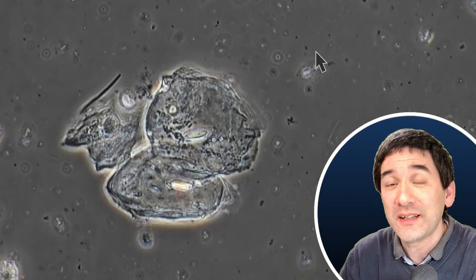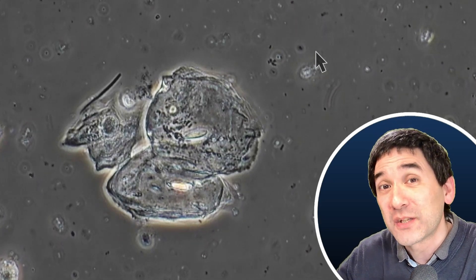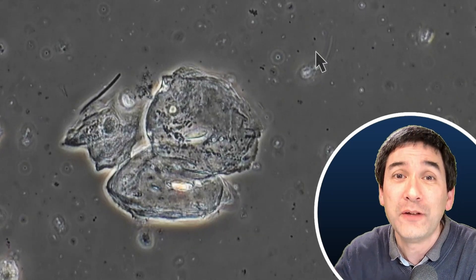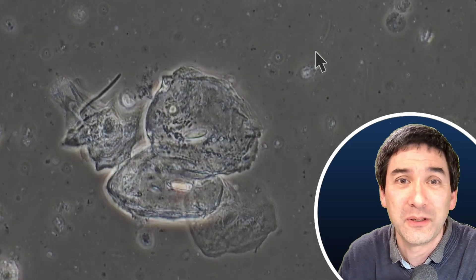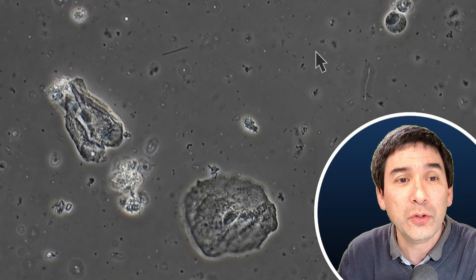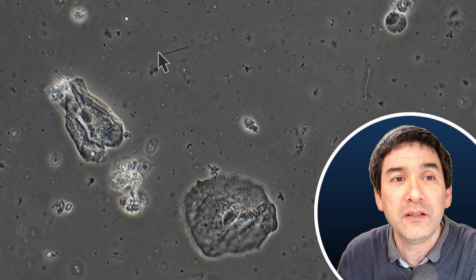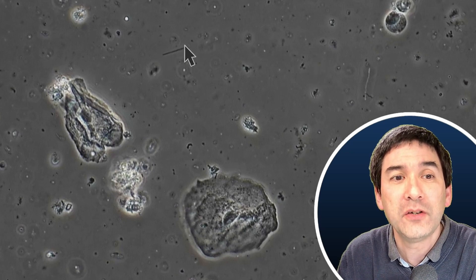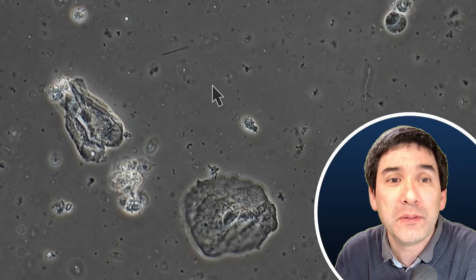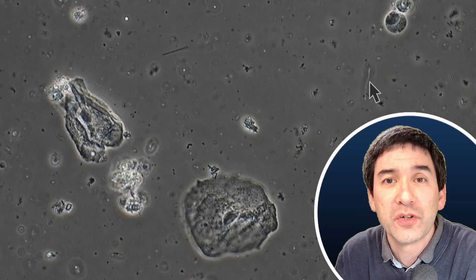You notice that there is movement here — this is because the saliva is now spreading beneath the cover glass of my microscope slide, causing a drift in the fluid that makes everything appear to be in motion. Here again I'm going to pause. You can see there are plenty of bacteria, and this one over here — these long bacteria — these are so-called rods. Rods simply describe the shape of the bacteria, and you can see a variety of different shapes.